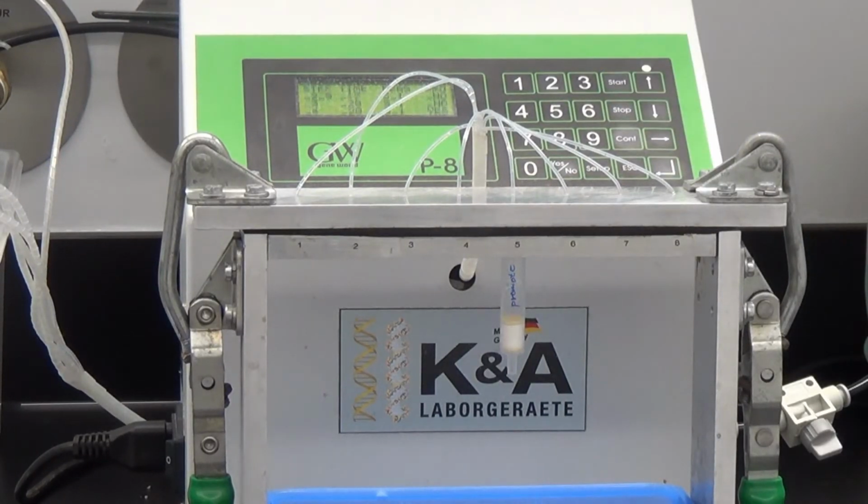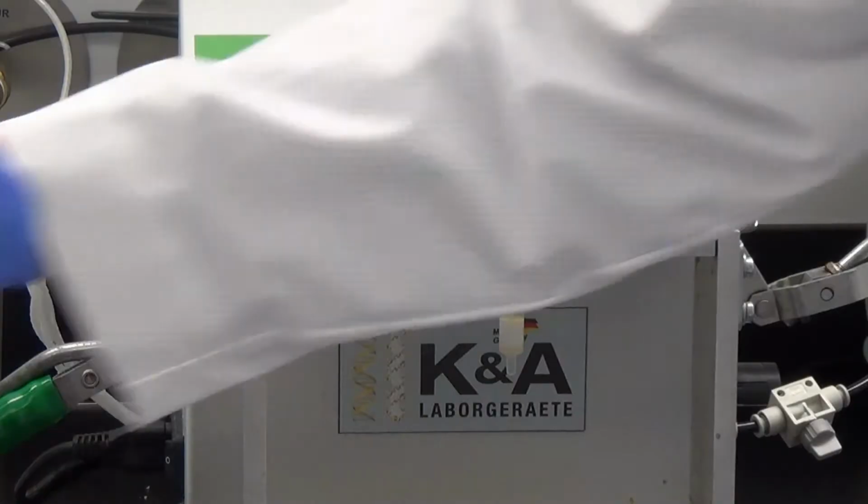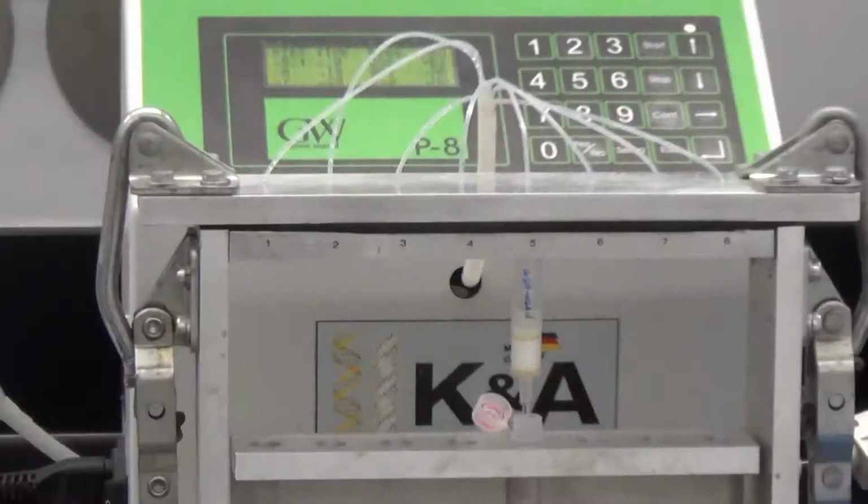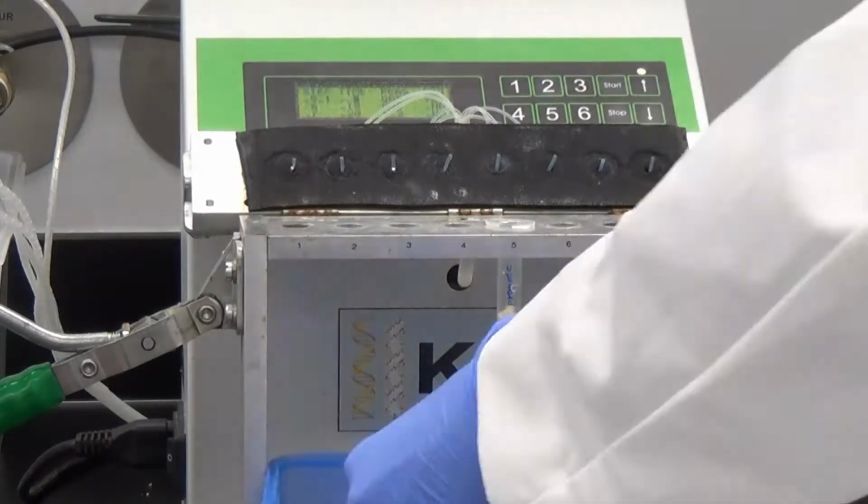We then need to purify the DNA sequence to only extract our wanted sequence. This is done by RPC, reverse phase chromatography. Solvent with different hydrophobicity affinity will help us target and elute our sequence from the sample.